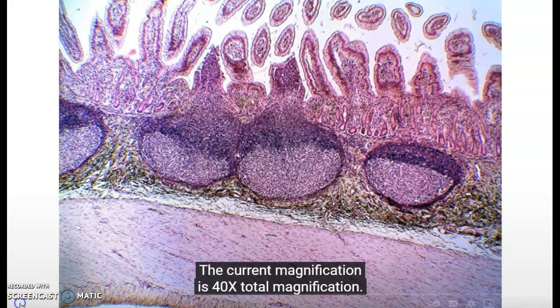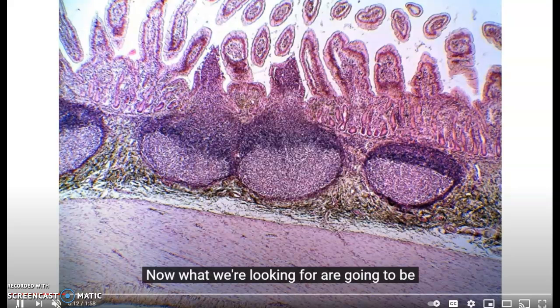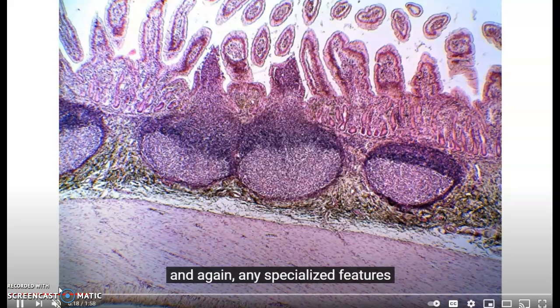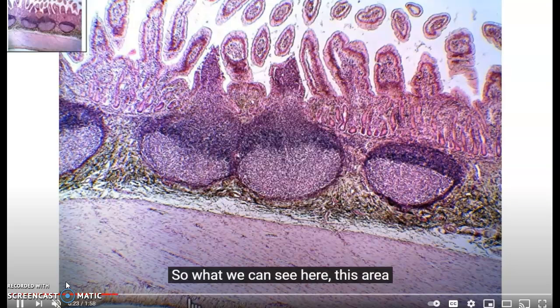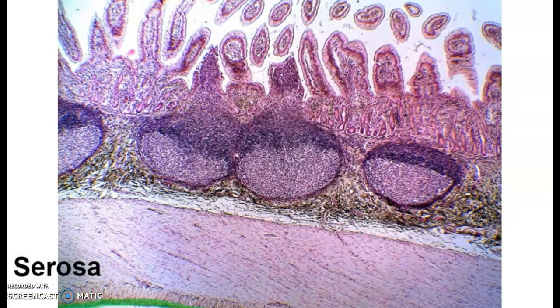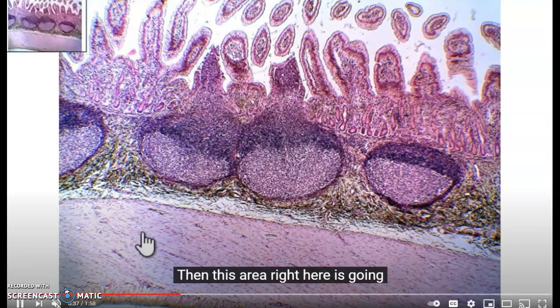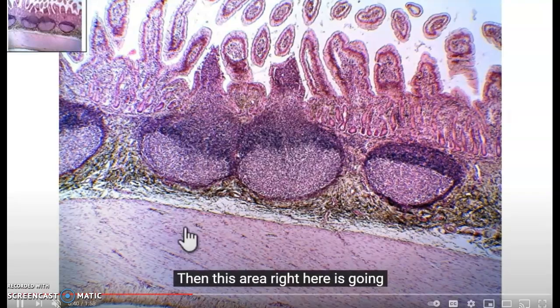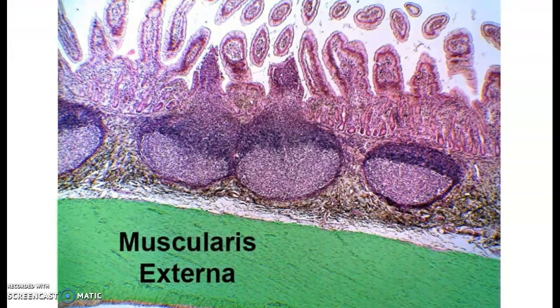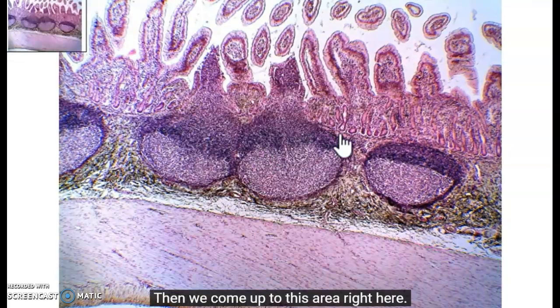This is a slide from the ileum. The current magnification for this one is 40x. And we're going to be looking for the tunics of our layers. Again, these are small intestine features. As you can see here, this area, write it down, is going to be the serosa, and the outside layer is the tunic. This area right here is going to be your muscularis externa. And remember, you have two layers here, the circular one and the longitudinal one.